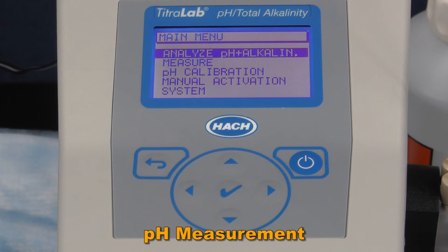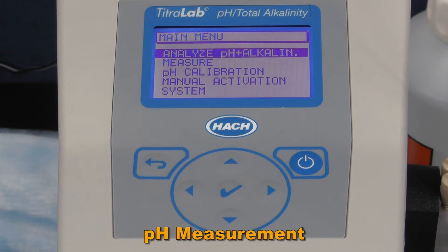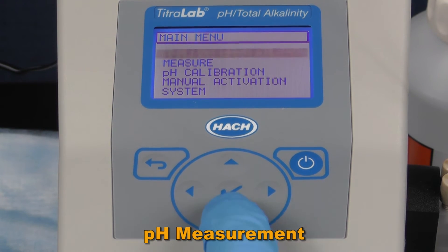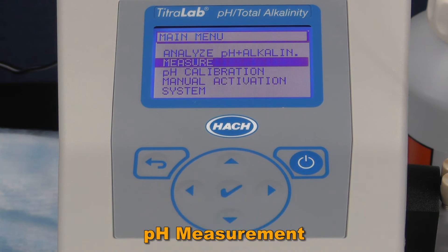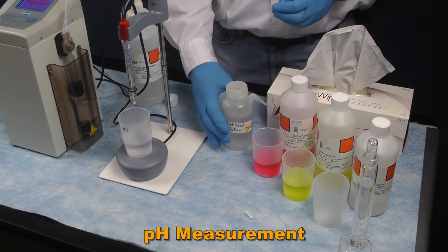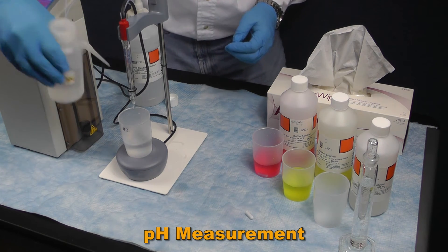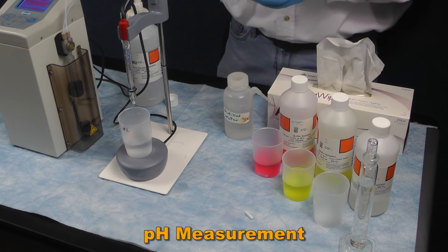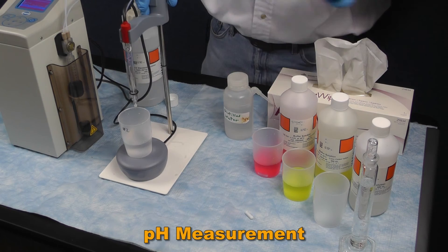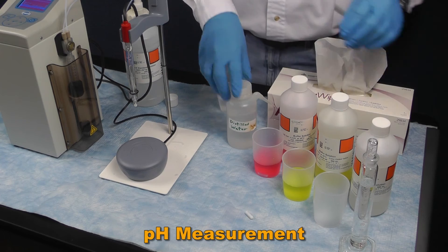Now that the pH probe has been calibrated, you can choose to measure just the pH of a sample or a combined pH and alkalinity measurement. For just measuring pH, select Measure pH. Place a waste beaker under the probe and rinse your pH probe with DI water and blot dry using a chem wipe or AccuWipe. For just a pH measurement, measure about 50 mL of sample into a sample cell and add a stir bar.